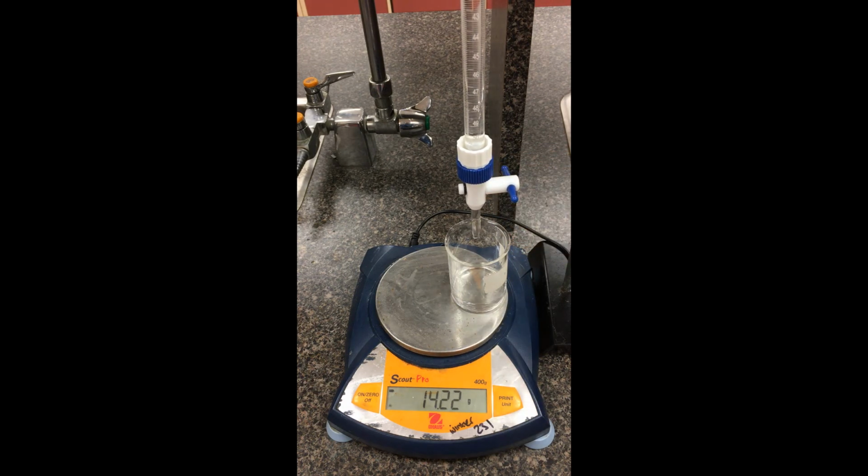Slightly under 18, but that's okay, we'll record it. So 17.95. There's that mass. Aim for 21. So almost spot on, 21.00 has this mass here. Down to the 24 here, went a little too far, 24.10 has that mass. Down to the 27, so 27.03 has that mass there.